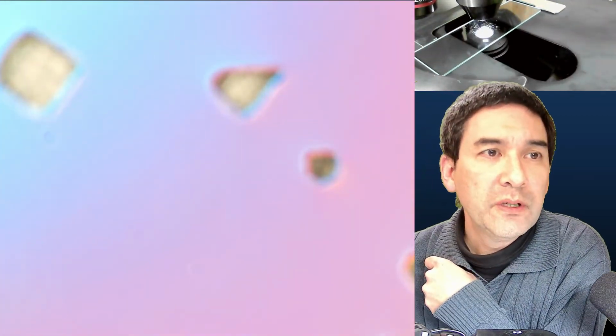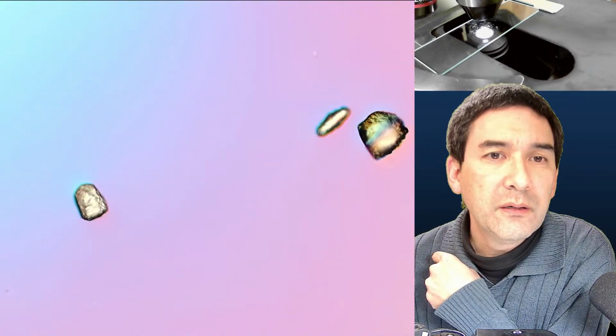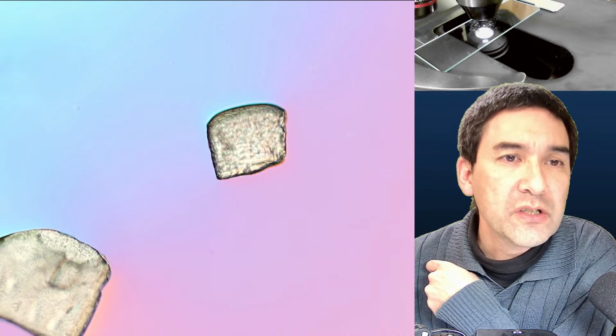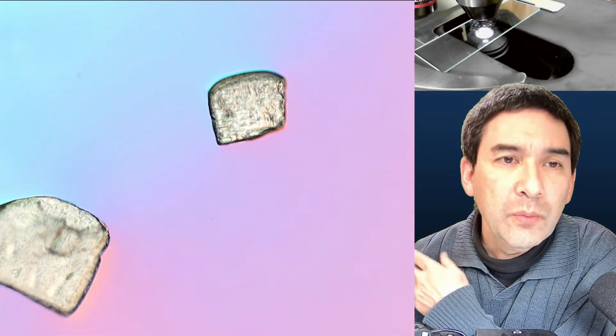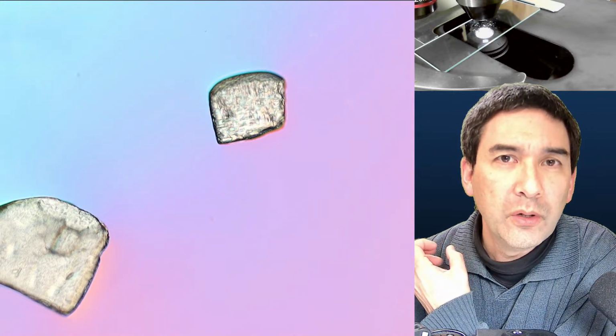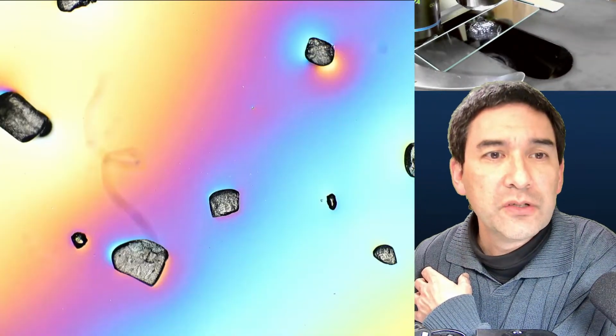So this here is vitamin C. A very nice thing to observe. And this is how it looks. We already have a saturated solution. That's why the remaining crystals do not continue to dissolve. And then what's going to happen is that as the water evaporates, more and more of the crystal is going to start to recrystallize. Maybe I'm just going to go down a little bit with the magnification so that you see a little bit how this looks.